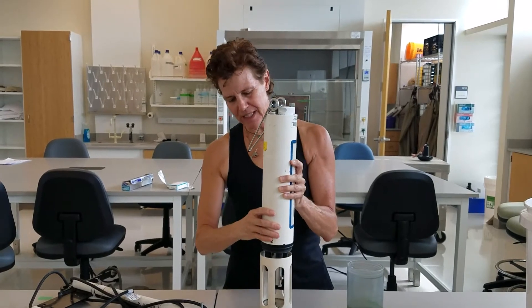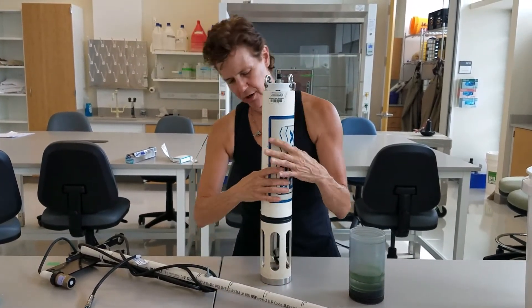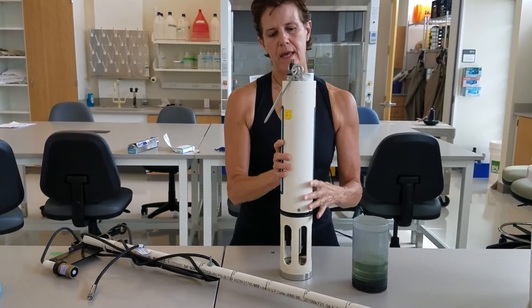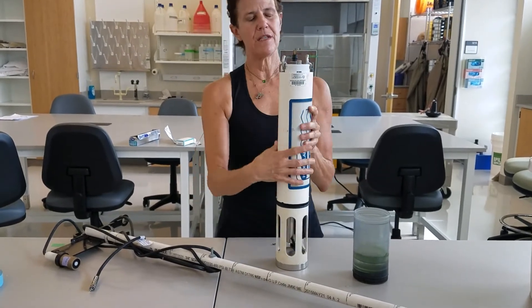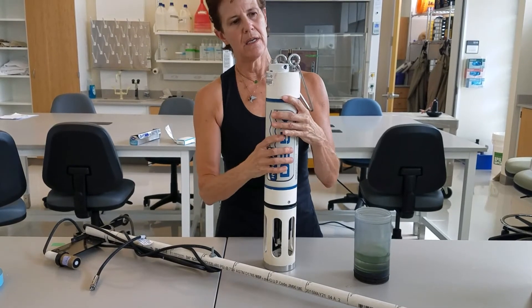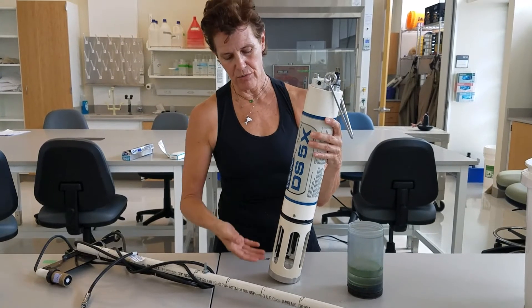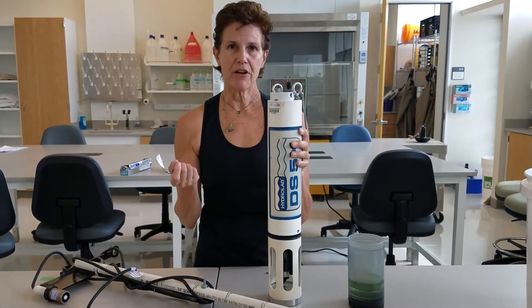In order to protect these very delicate meters in the water, we put a protective cage around them. The electronics on this device are connected to a handheld display that tells you what the detectors are seeing, and we write those readings down.